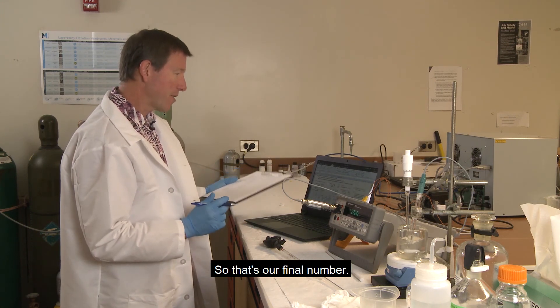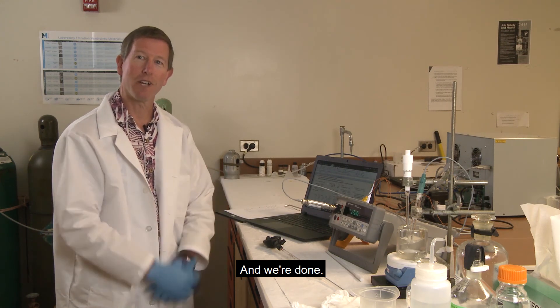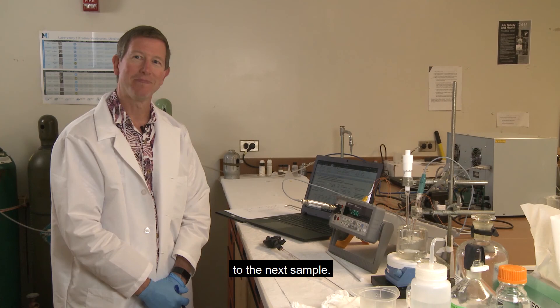So that's our final number, and now you've done a successful alkalinity titration, and we're done. Ready to move on to the next sample. Thank you.